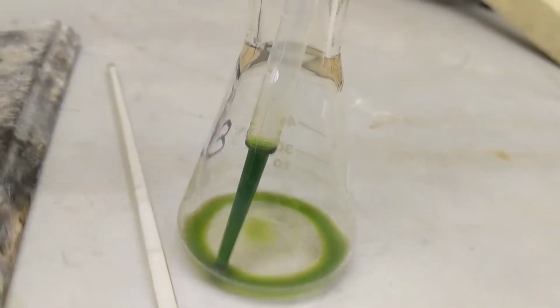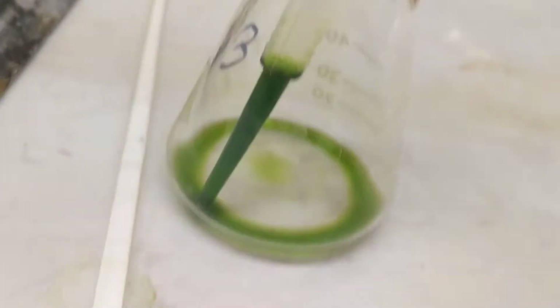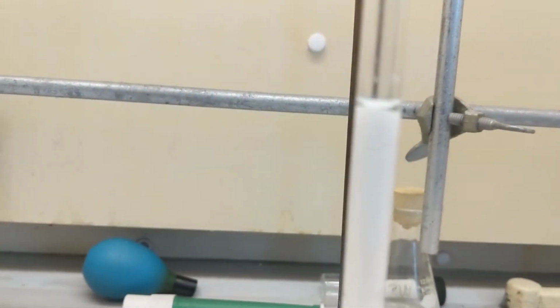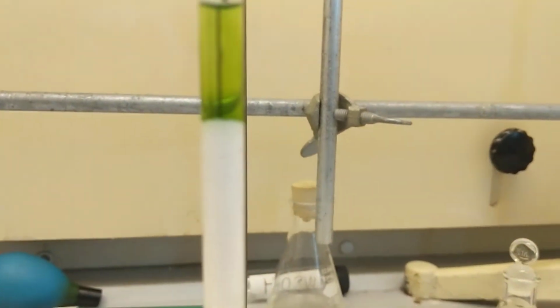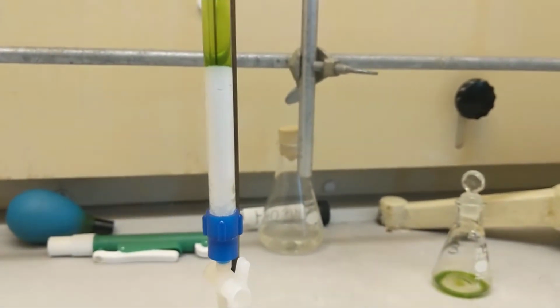You see that? Now what I'm about to do is add 1/4 of a milliliter of pigment, just enough to have a little bit left to run my plate. I'm going to add it to the top and watch it seep into the top layer. Come back in a second. Alright, added my pigment. You can see it up there. Y'all see? And I'm just going to watch and see if I get a yellow band pulling down my column.